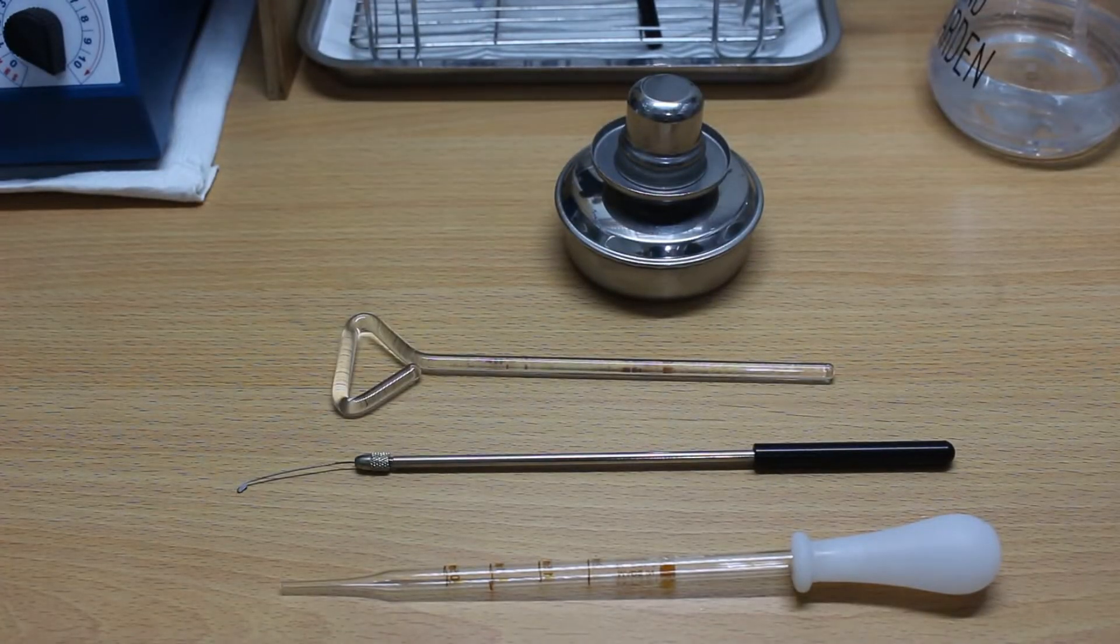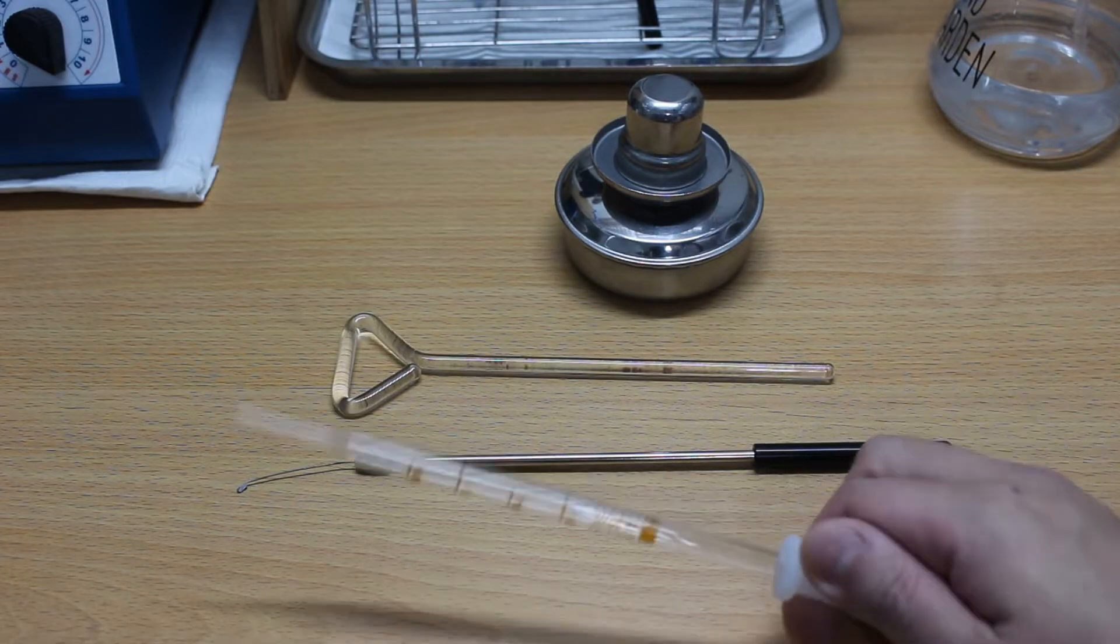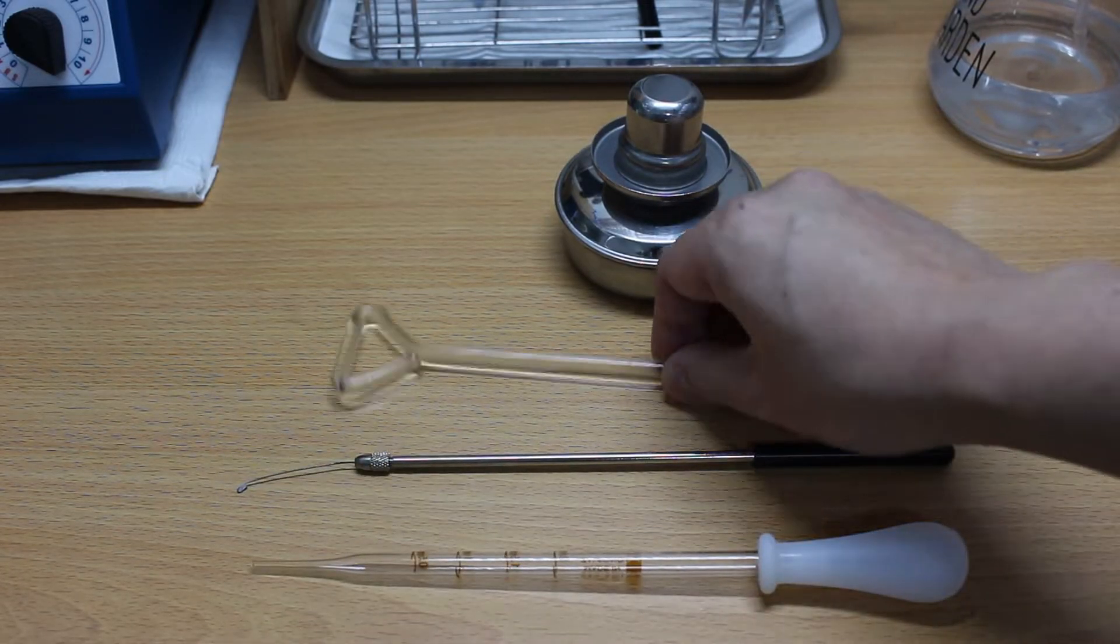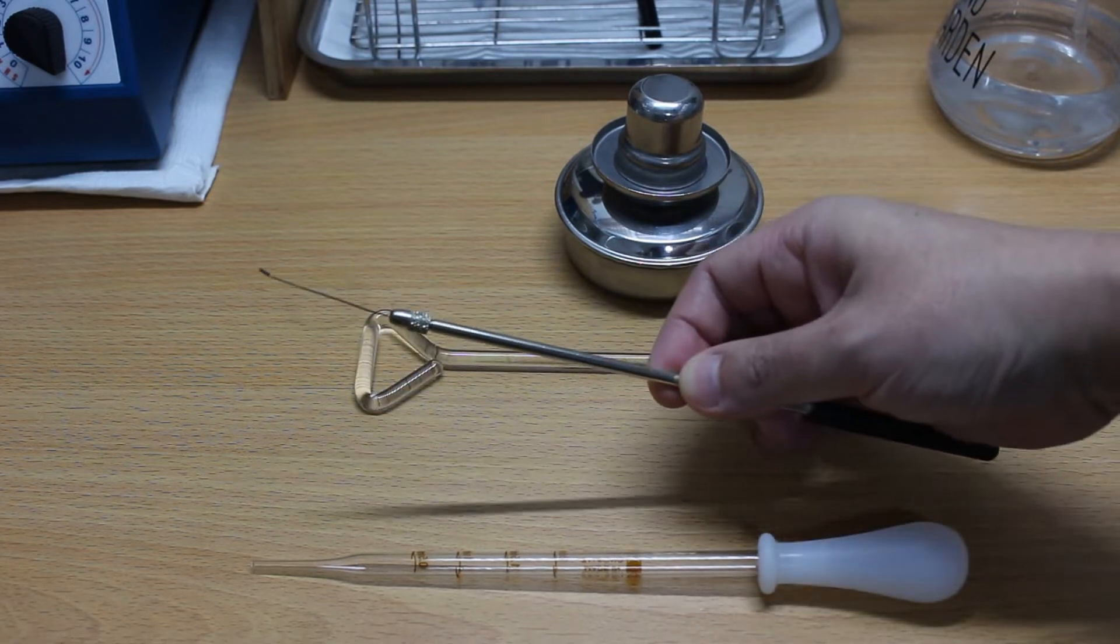Now before starting, you will need to prepare some tools. The tools that you will need are a dropper, a spreader, an inoculation loop, and an alcohol lamp.